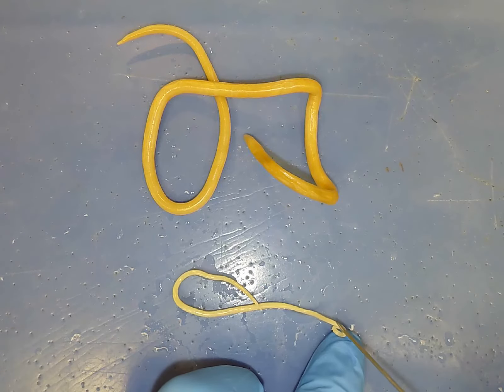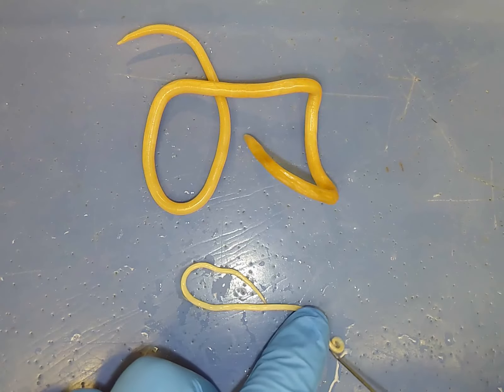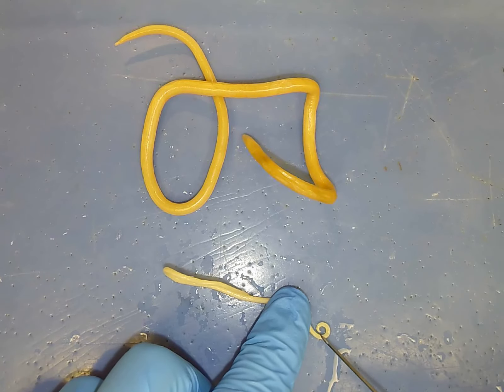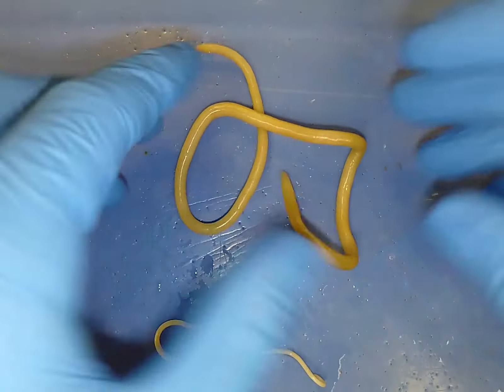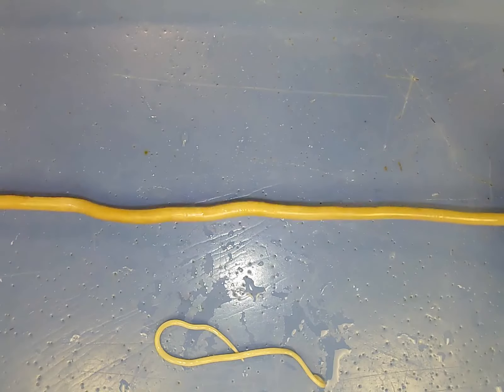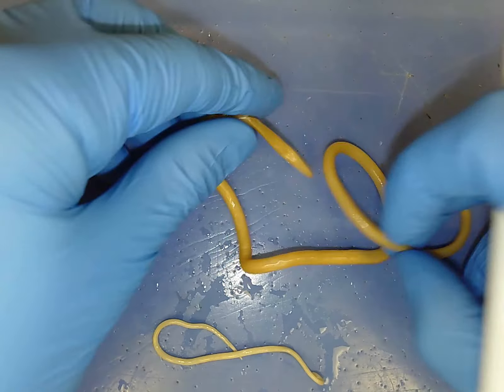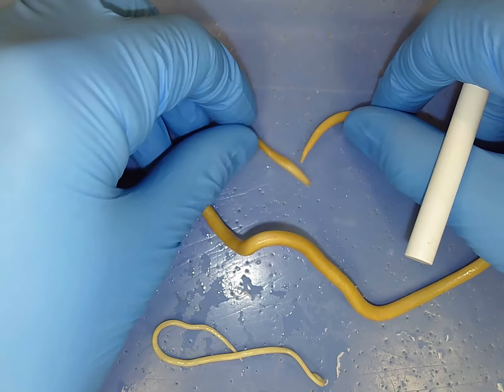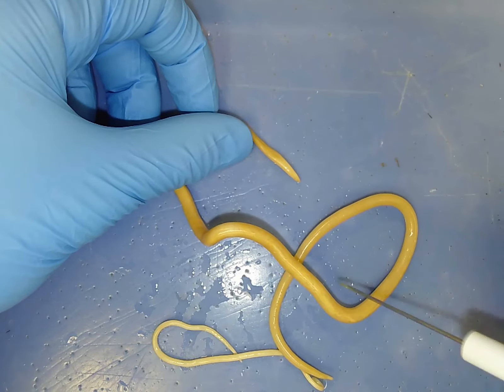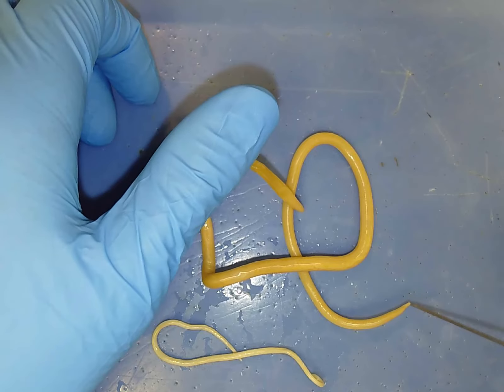This is the posterior end of the male and here is the anterior end. The mouth of this individual is going to be here, and the anus will be right about here at that spiral end. Females are much, much larger — in terms of width and length, it's probably three or four times as large as the male. Externally it doesn't have very many distinguishing features; this isn't a segmented worm. There are no rings like you saw in the oligochaete or earthworm, and it's difficult to determine which side is which without a dissecting scope, so we'll rely on internal anatomy.